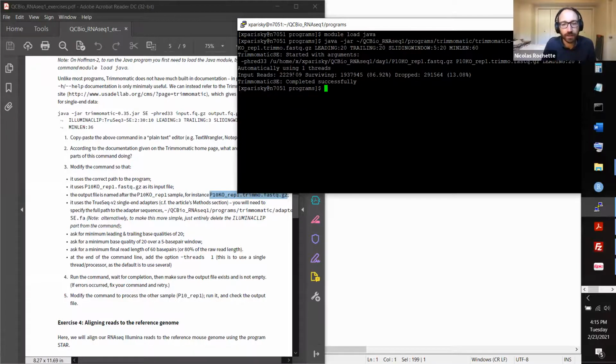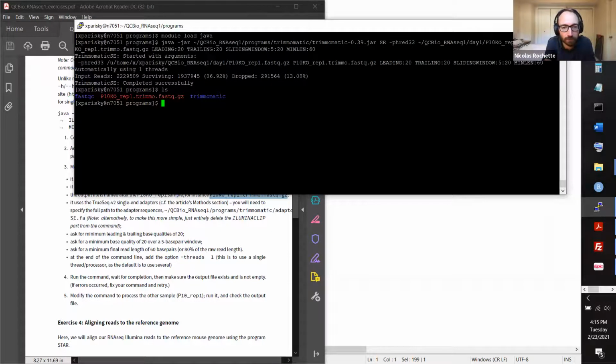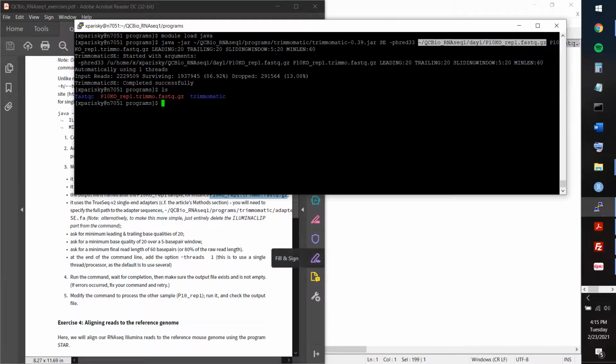Can you do ls? Yeah. So one thing I can mention here, and this is exactly how you're supposed to run the program, and you modify the right things. One thing you can comment on is how you needed to modify the input file to have the path, like specify the full path to the input file. So like after phred33. Yeah, so here really, what the program expects is a path. And whenever a program is asking for a file name, it's actually expecting a path. And the file name is really just the last bit of the path.